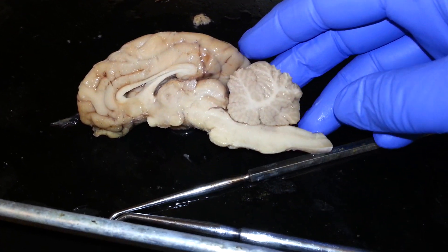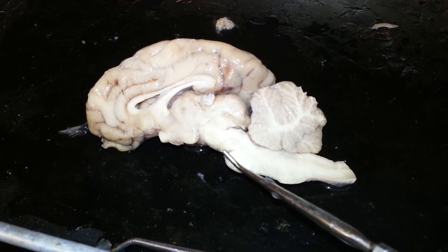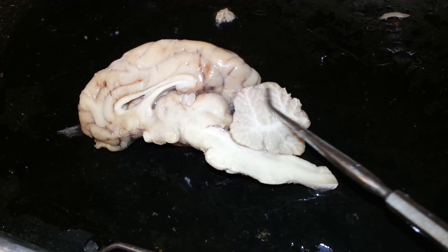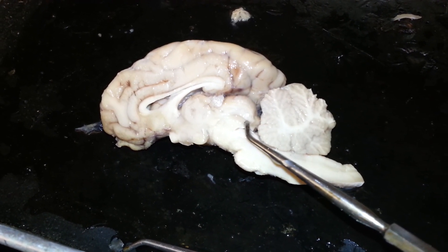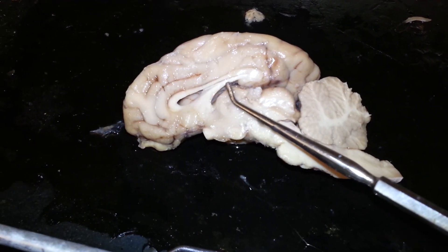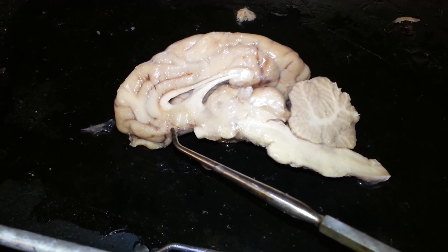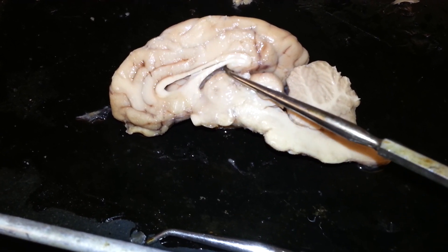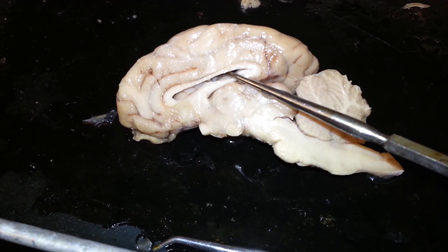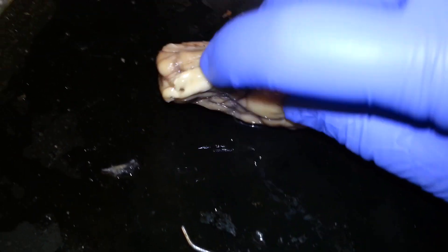Really fast, one more time going through: we have the spinal cord with the central canal, medulla, bump two — the pons, the cerebral peduncle, aqueduct of Silvius, and the fourth ventricle. Cerebellum, corpora quadrigemina, inferior colliculi, superior colliculi, pineal body, thalamus, hypothalamus, mammillary body posterior, optic chiasm anterior. Then we have the third ventricle, fornix — pull that down to see the lateral ventricle — and then above that is the corpus callosum. There should be the septum pellucidum but we tore it away. And then the olfactory bulb.